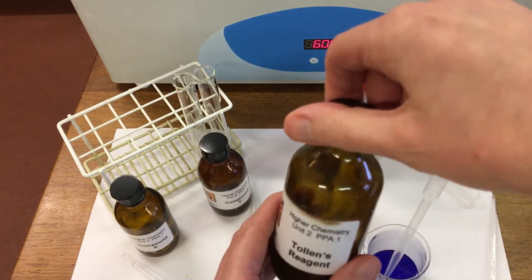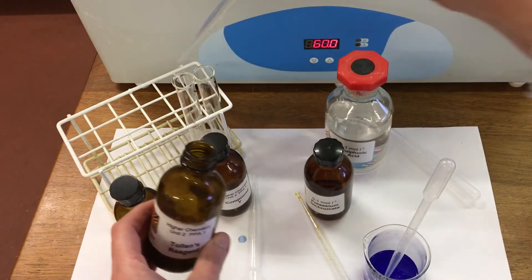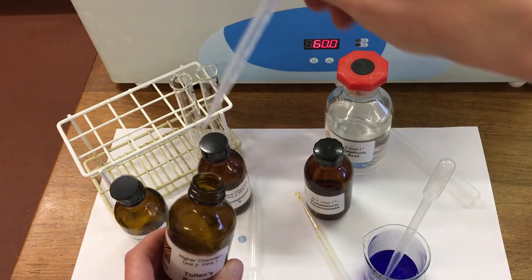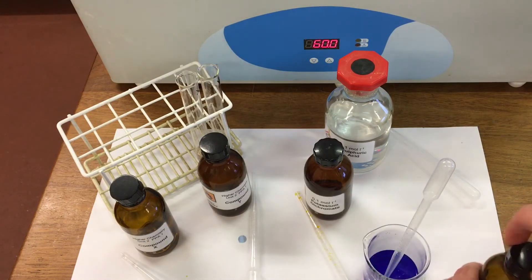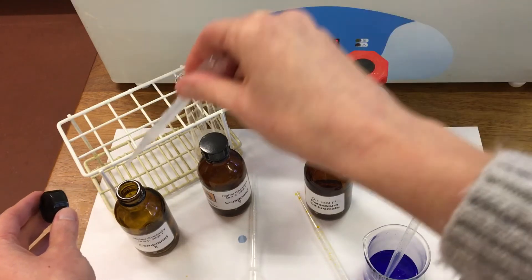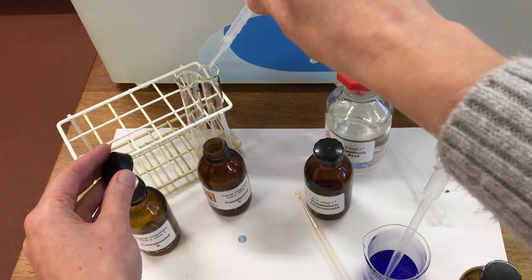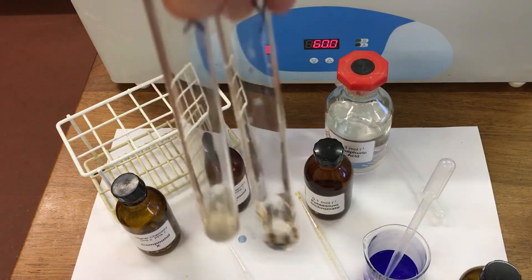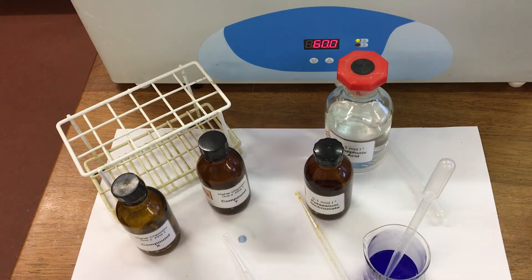Our next oxidizing agent is Tollens' reagent, so again we're going to put a couple of mils into each test tube, and then five drops of each compound. Once again we'll give these a little mix and pop them into our water bath.